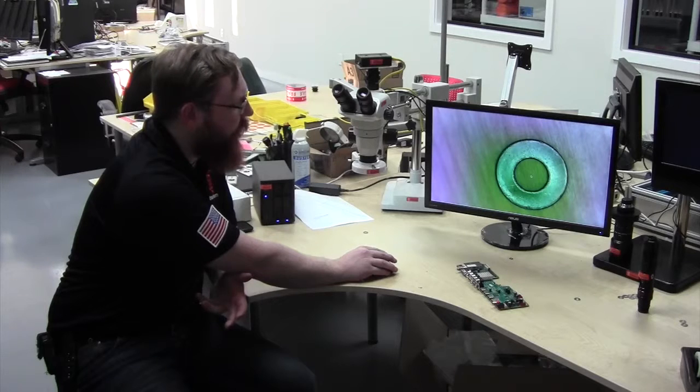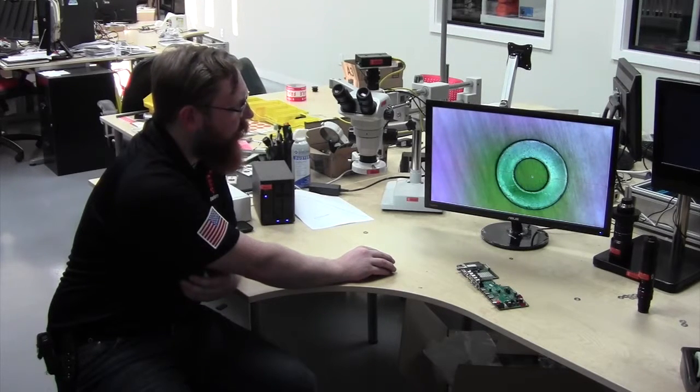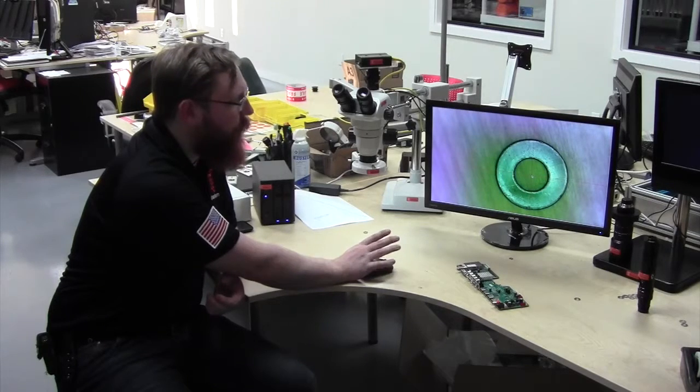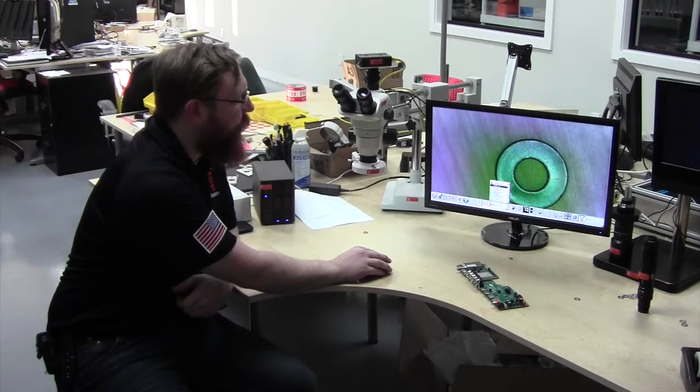If I want to do the center of this washer, let's say, I will set both of those as the center. If I want to do the inside diameter of those, I can set another crosshair to just the inside diameter. If I want the outside diameter, I can choose another color and set it to the outside diameter. And you can do that both horizontally and vertically.